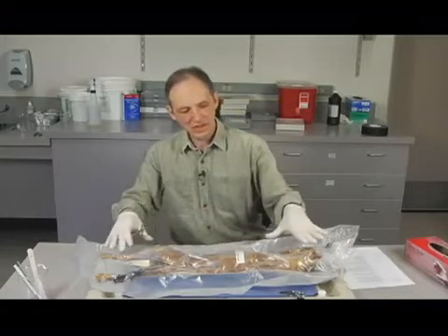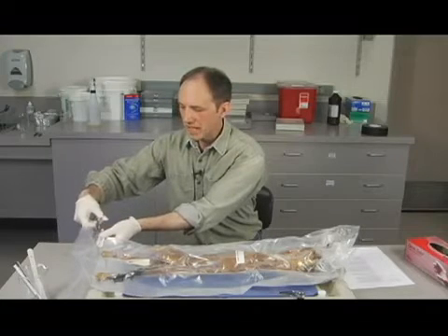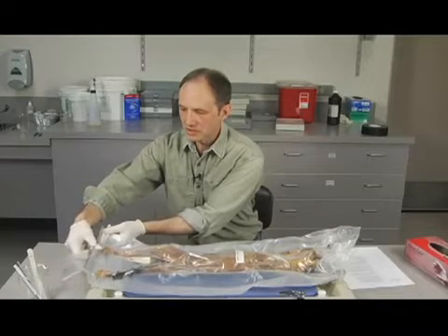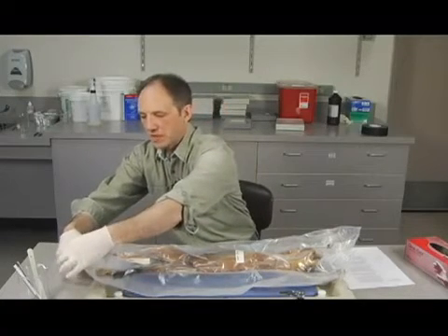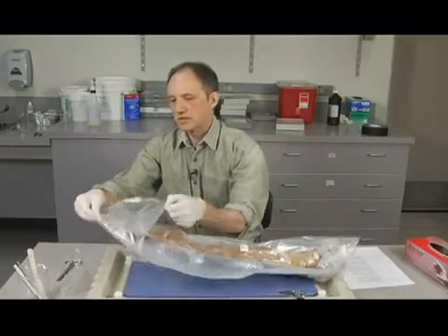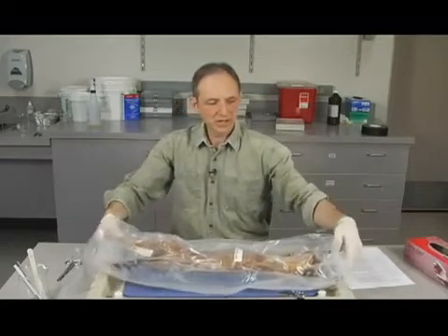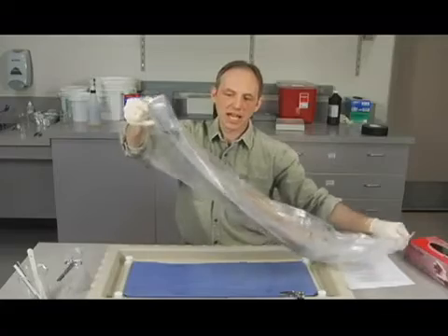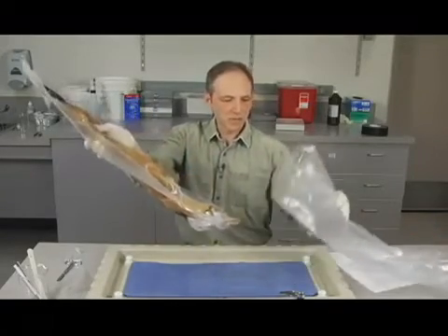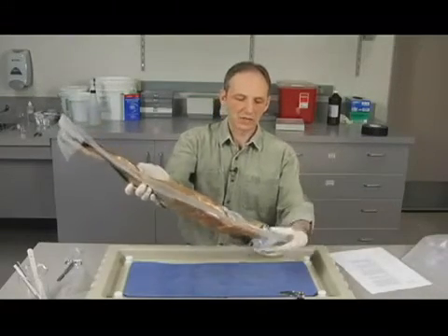Like I said, you can see the cat here, the head end and the tail end, and we'll cut the plastic bag near this far end. Let's see how this goes. They're vacuum packed in here, so it lets some air in right away. Okay, so there we go. I opened it up a little bit, and like I said, there are 2 bags. Now I'm going to pull the cat out. As you can see, the second bag is still there. First bag's nice and clean. There's no fluid or anything in it. I'm just going to set that aside over here.